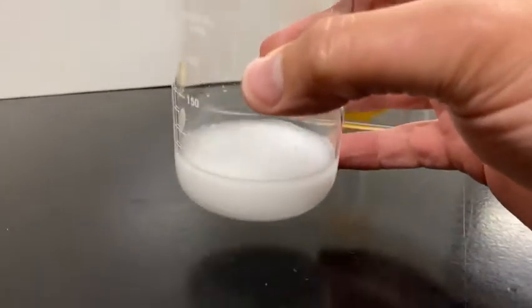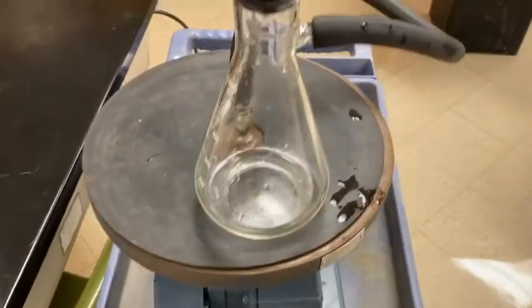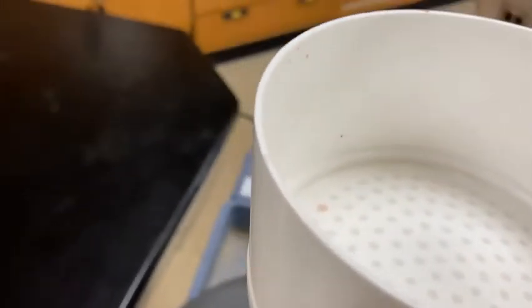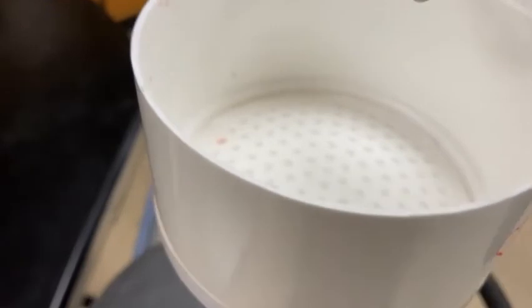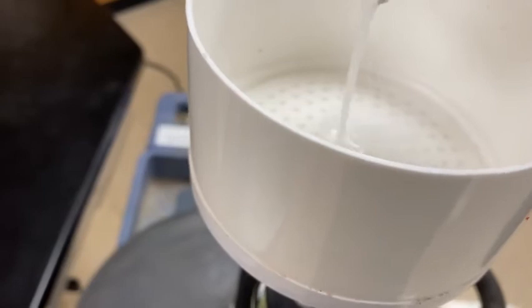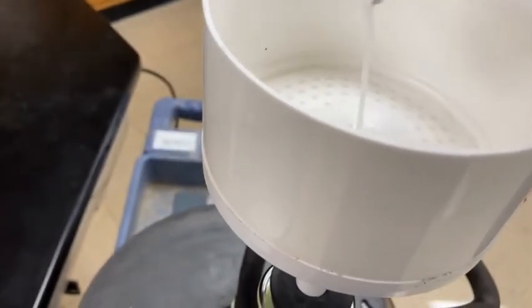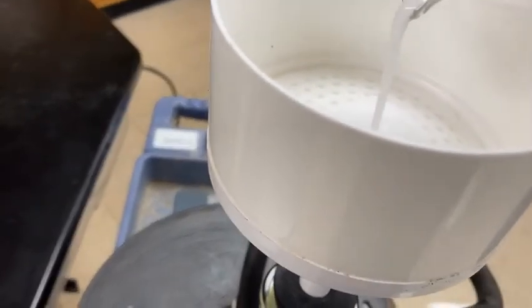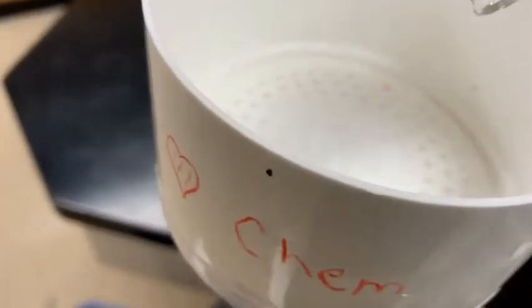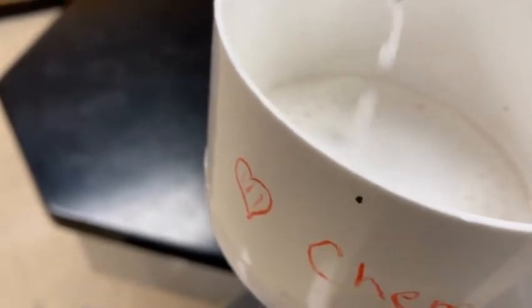I'm going to do that by using the Buchner funnel. So I've got the vacuum flask running, the Buchner funnel. I re-wetted the filter paper just to make sure it had good suction. And now we're going to pour the precipitate into the Buchner funnel. I'm going to go slow here, so that I don't just dump it in and it's all liquidy. I want to make sure that the precipitate gets trapped on that filter paper and doesn't leak out around the sides of the filter paper.